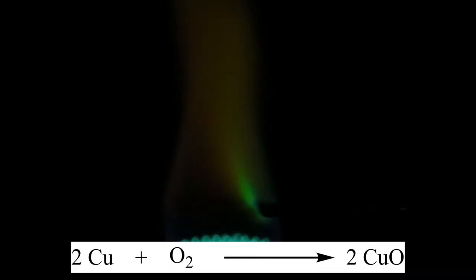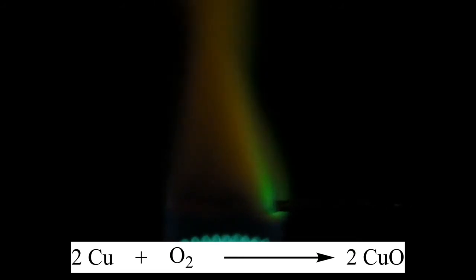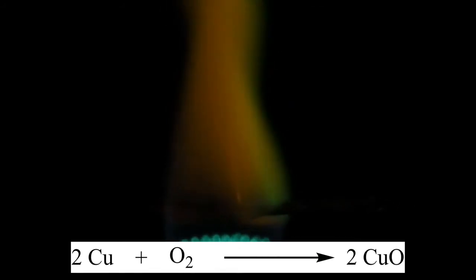According to the protocol, the sample is then placed on the glowing wire, where especially liquid compounds are likely not to stick to the hot surface. So it was left to cool in the liquid. Practically, the wire could also be left to cool before dipping it into the sample, but there is a slight risk of it being contaminated by dust particles in the air.